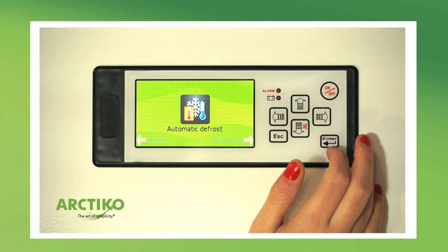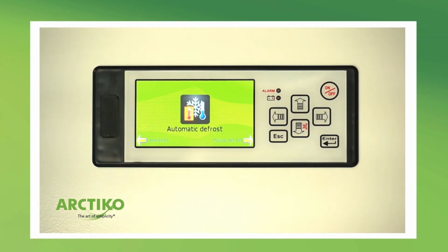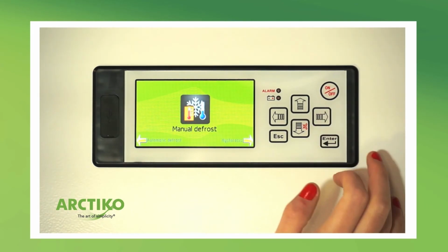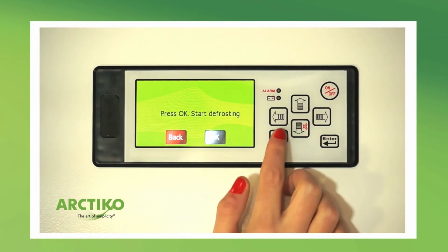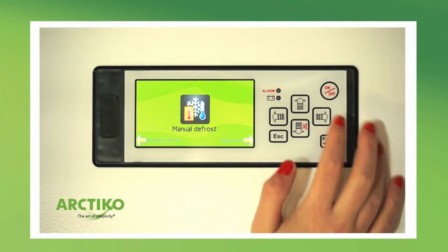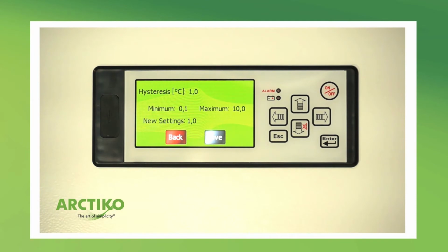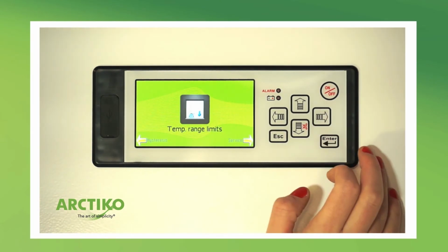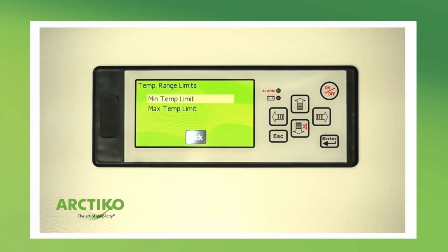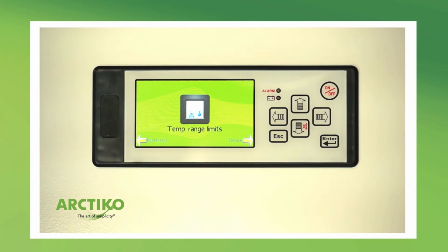In automatic defrost, set the time when an automatic defrost should be performed. In manual defrost, you can start the defrost immediately. In hysteresis, set the difference of the set point when the compressor starts and stops. Temperature range limits is the maximum and minimum temperature the unit can operate in.